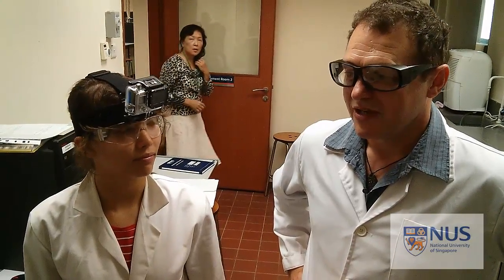This is one of the module CM3292 practical videos. The idea of these videos is to show you the equipment you'll be using and how that equipment works in terms of your use of it. So we won't particularly refer to the practical, which is the electrophoresis in this case. Instead, we'll start by turning the equipment on, walking you through the use of it, how it works and how the software works.